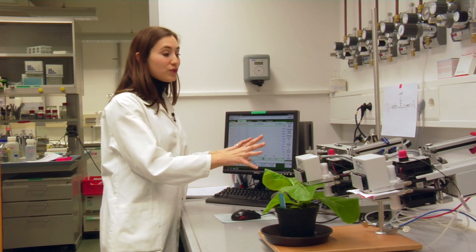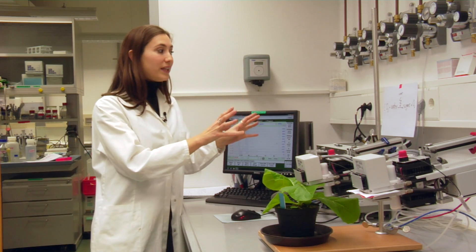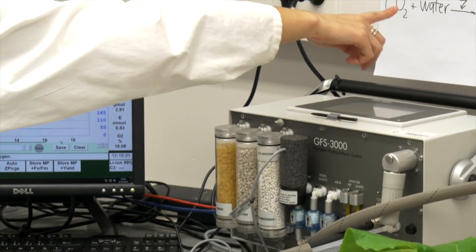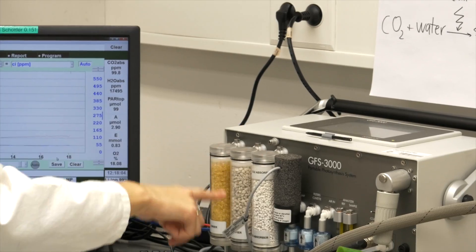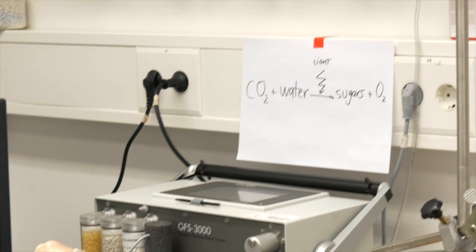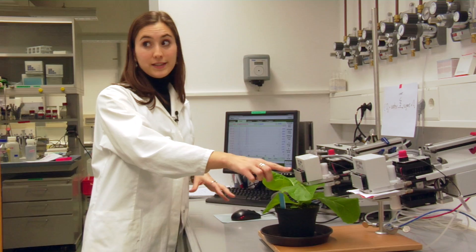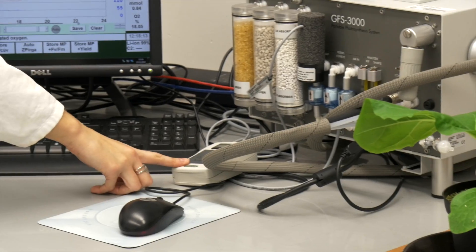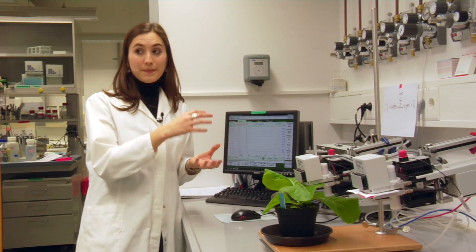This machine allows me to carefully control the parameters of this reaction. I can control the humidity, so the water, and I can control how much CO2 reaches the leaf. I can also control the intensity of the light that reaches the leaf, and the oxygen. So by controlling these parameters I find out how much CO2 has been uptaken and thus the photosynthetic rate.